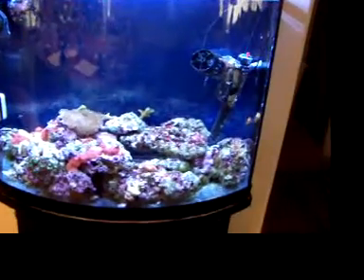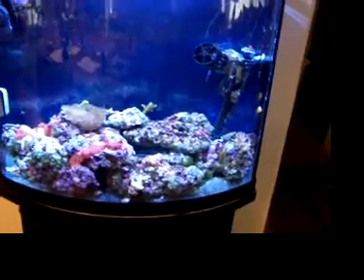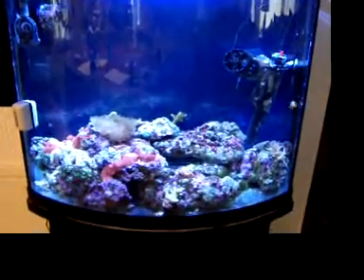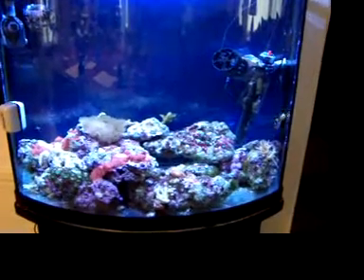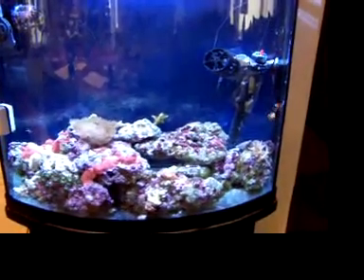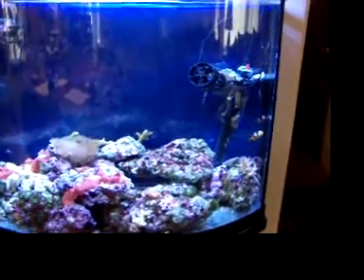Hello YouTube lovers. This is Raptor 268. We just got together a new tank here and I wanted to show you how to test for the carbonate hardness and I just bought a new test kit.